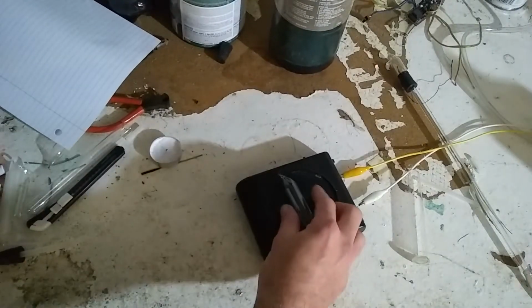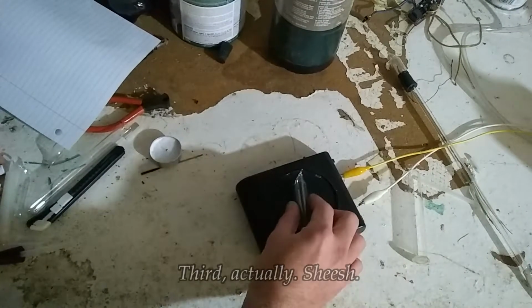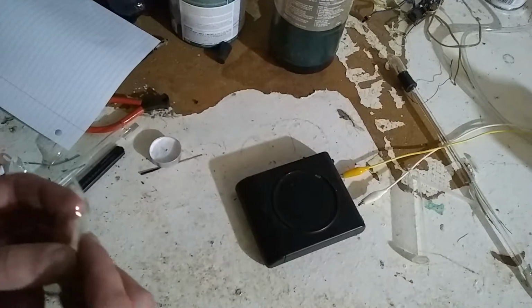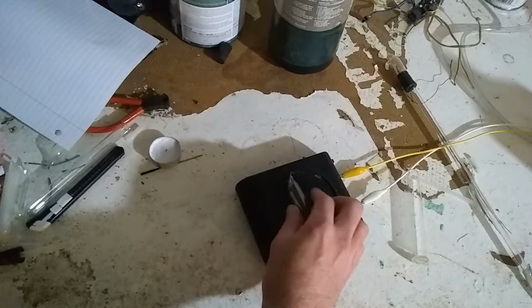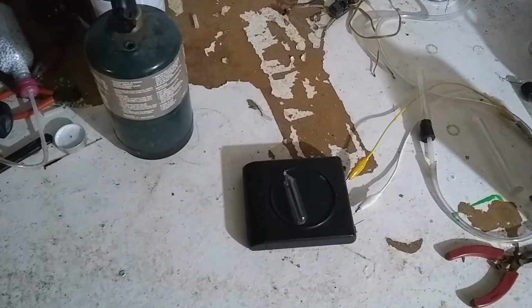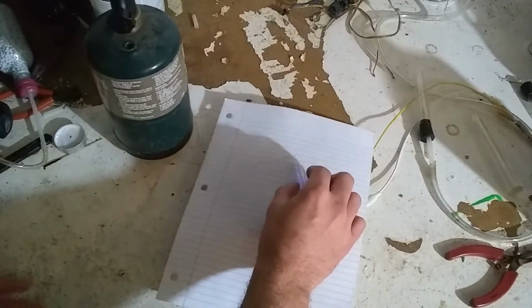Alright, my battery was getting low, so I didn't catch it on camera, but I made a second oxygen ampoule. Are you kidding me? I made another batch of oxygen and another ampoule off camera because my battery was low. There we go.